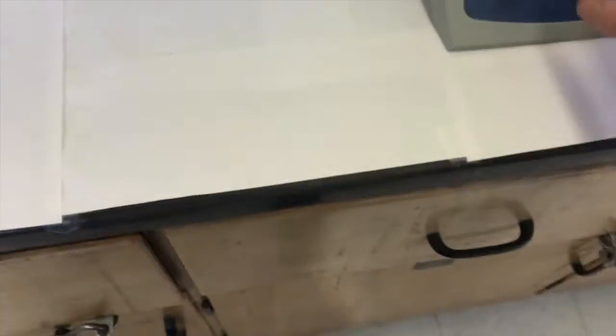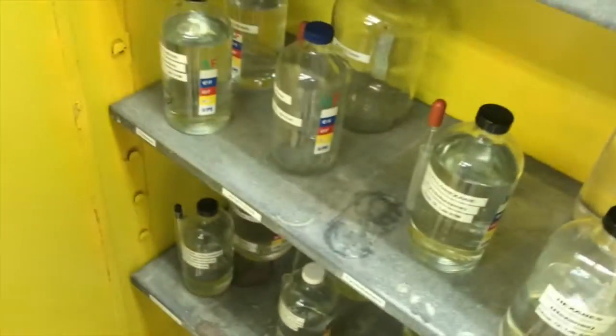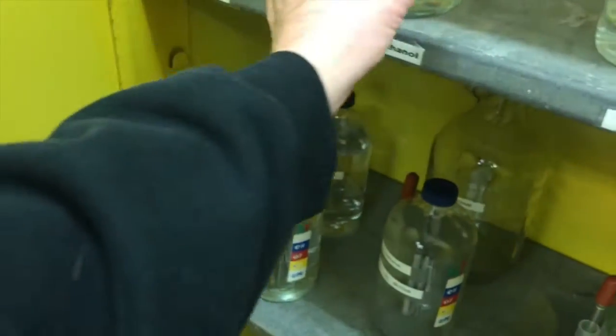Usually in lab, if you're making a molecule that you've never made before and you can't find a literature reference for it, then you'll try out some solvents that you think might work just by considering polarities, saying, oh, I want something where the molecule's fairly soluble but not too soluble.